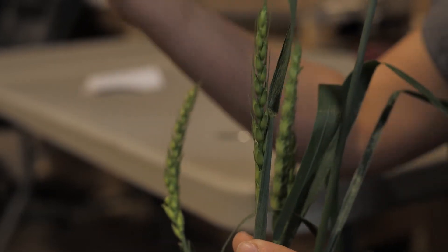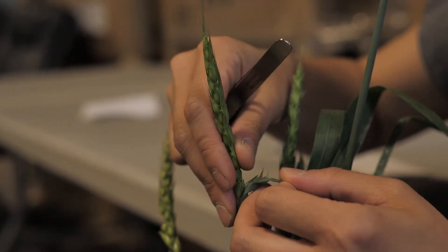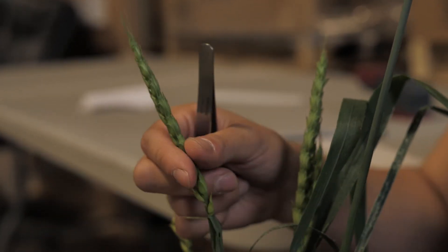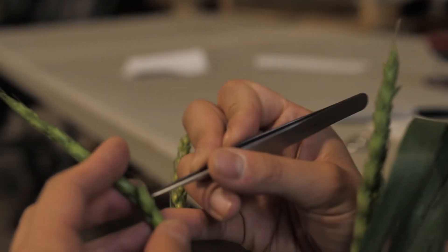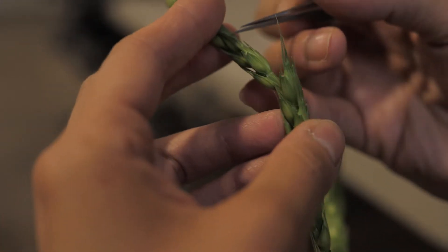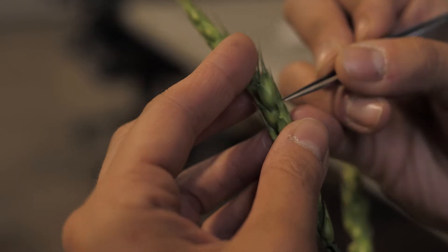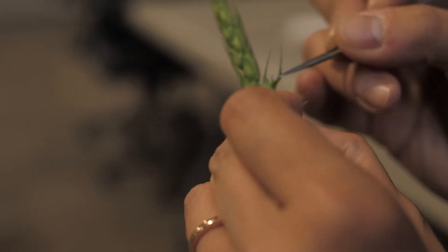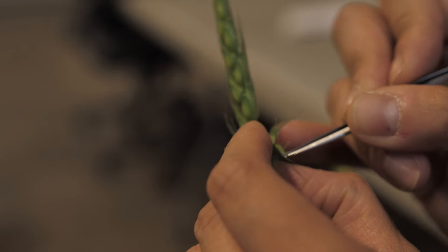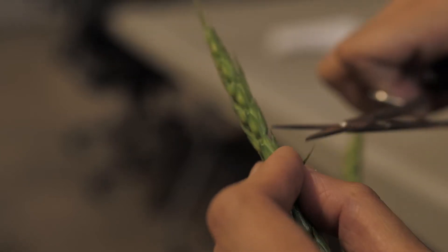Here's another female head, about 50 to almost 75% out of its boot, so we can pull that down gently and now we emasculate. Here's a spikelet — there are usually about three flowers inside, so I'll separate this to show you. Here's the first one, second, and third. To make it easier I'll pull out the middle one so we can focus on two, and then give it a haircut at about halfway.